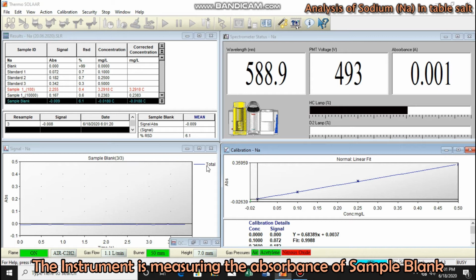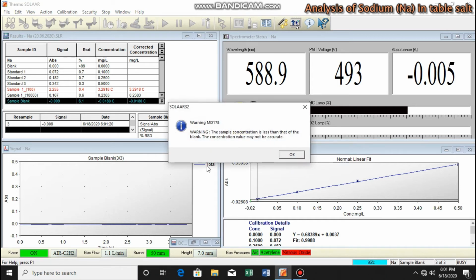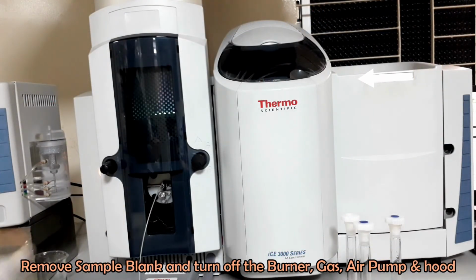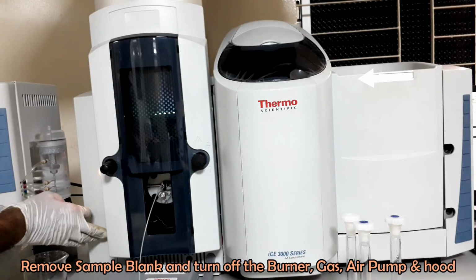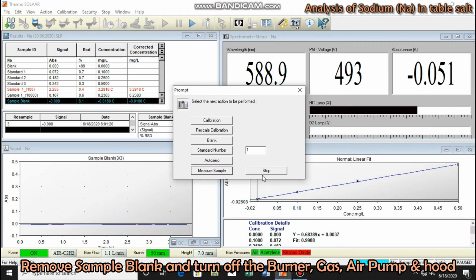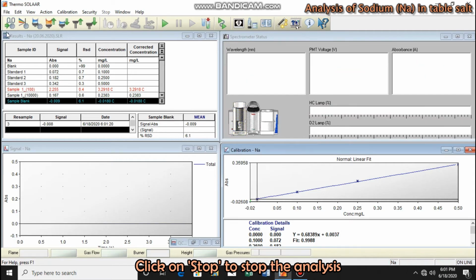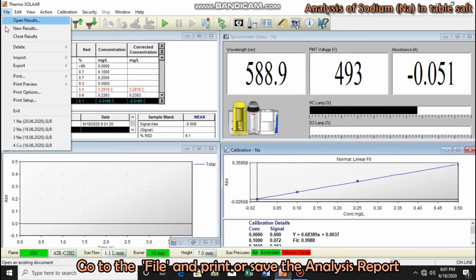The instrument found that the absorbance of sample blank is less than the blank absorbance, which is irrelevant. This is why we will not consider the sample blank reading in the calculation. Remove the sample blank and turn off the burner. Save and print the test report.